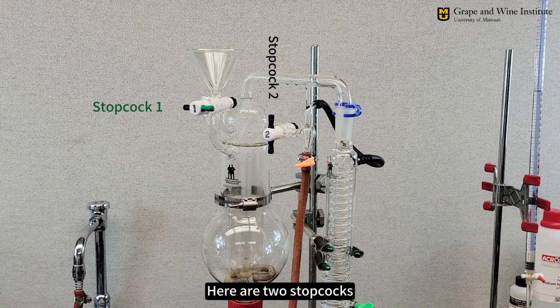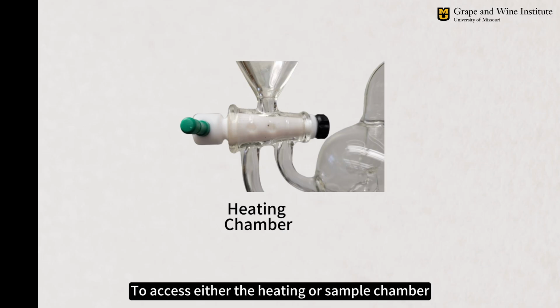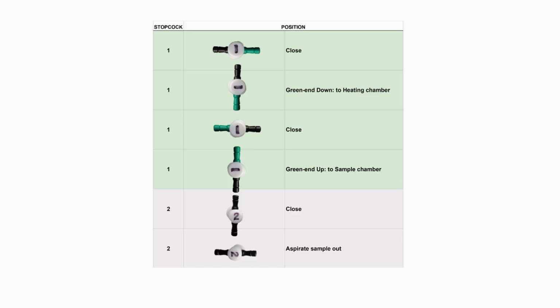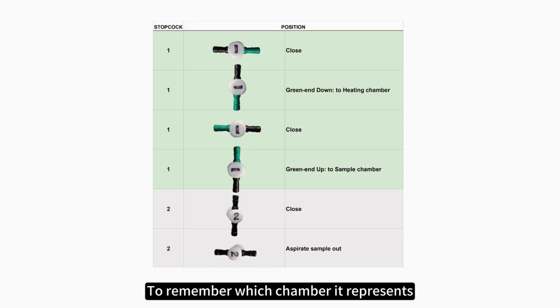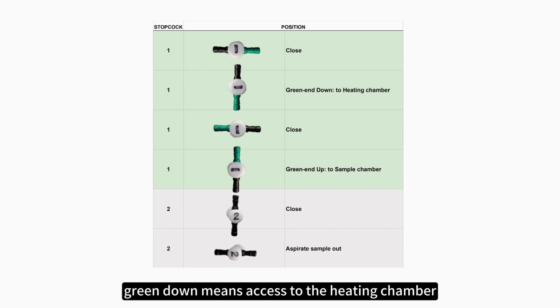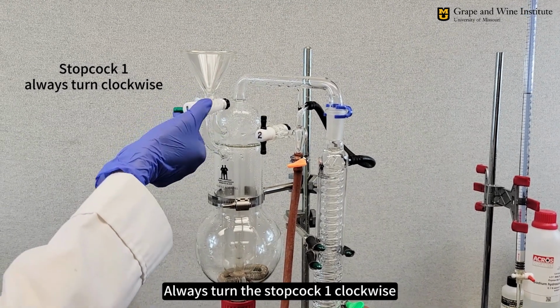Here are 2 stopcocks, the stopcock one on the funnel, on this Cash still one end with green color. To access either the heating or sample chamber, you need to turn it to the vertical position. To remember which chamber it represents, in our setup, green down means access to the heating chamber, and green up means access to the sample chamber. Always turn the stopcock one clockwise.